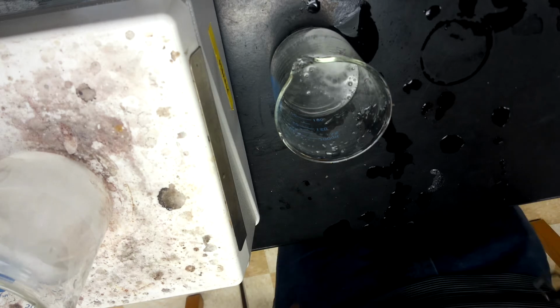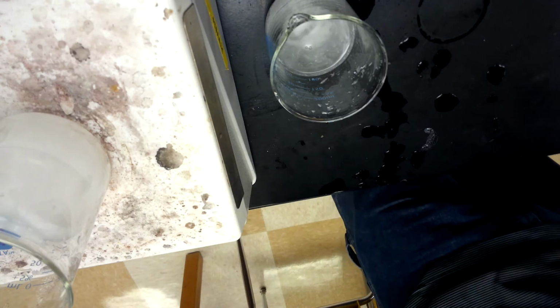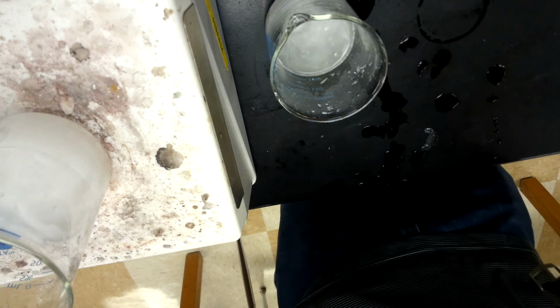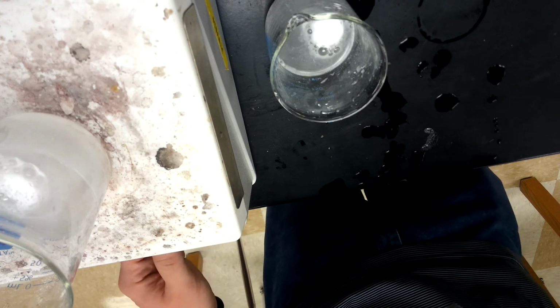So reminder from notes that stirring adds mechanical motion. It actually moves things around more mechanically. That's what stirring does. So then we're just kind of watching the paint dry, thinking about what should happen. If we got more motion, what should happen? Who knows? Crank that up a little bit.